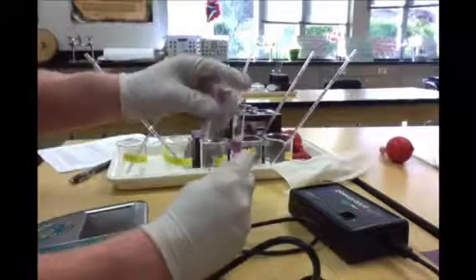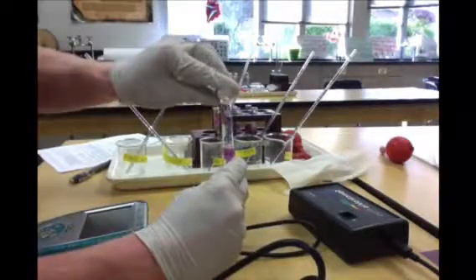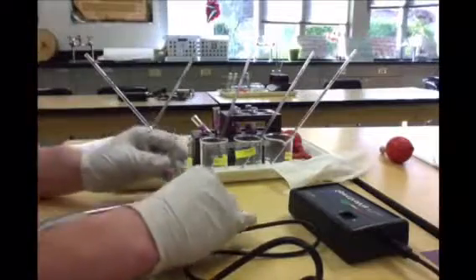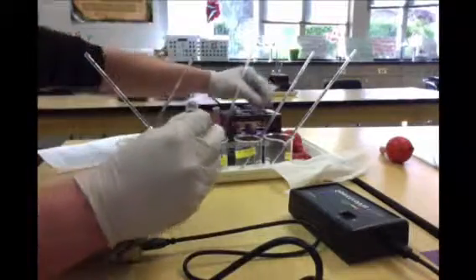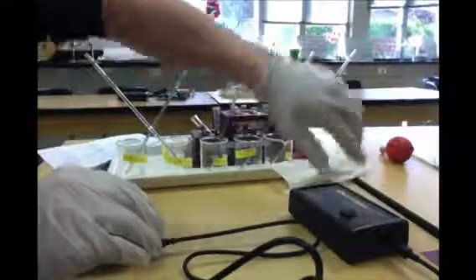So here we go. And always be careful. Don't go too fast that you hurt yourself. Start now? Yeah. So now that I have them mixed, I want to put it into the cuvette. Okay, that's in the cuvette now. So what I'm going to do is put it in the light spectrometer. Now start.